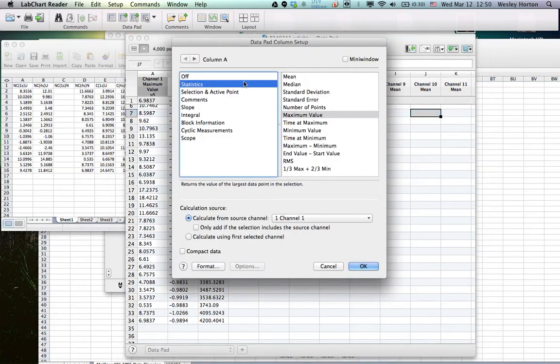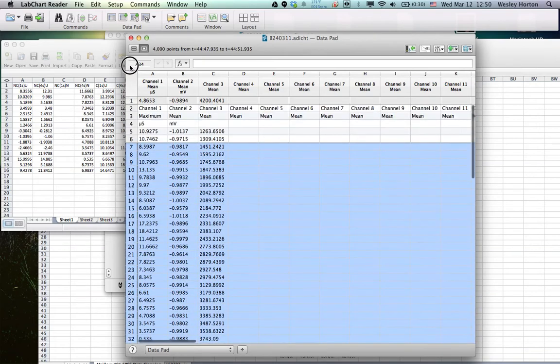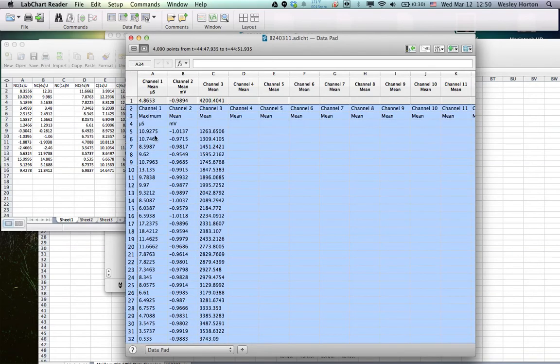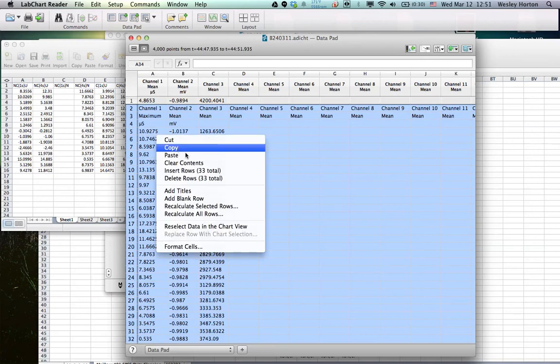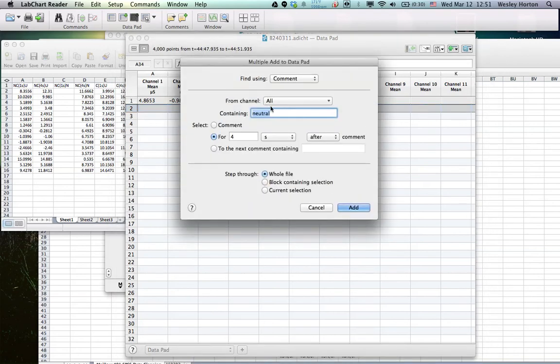We'll change this back to mean. Okay. Alright, and we're going to delete all this data. So it's so much easier to look at. Alright, and then multiple add to data pad again. Select neutral for 1 second before comment. Whole file? Yep.